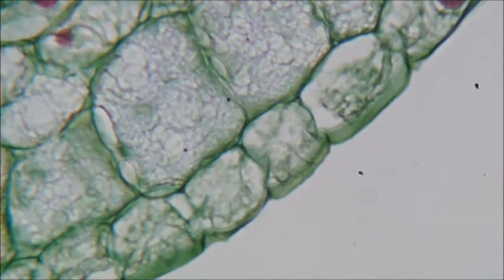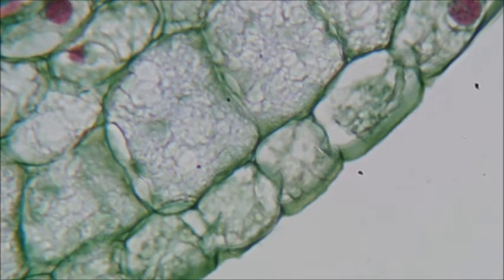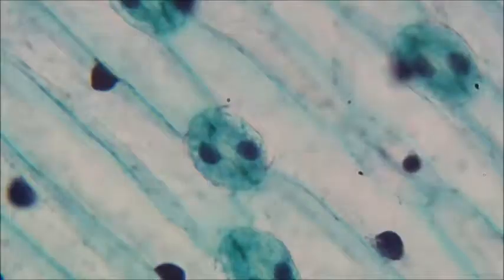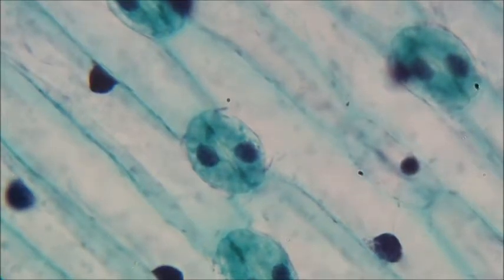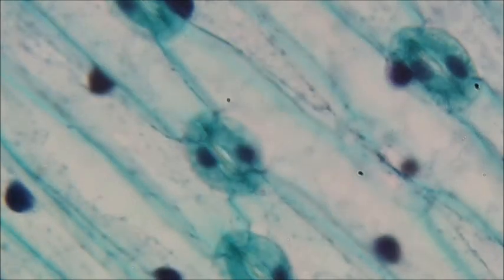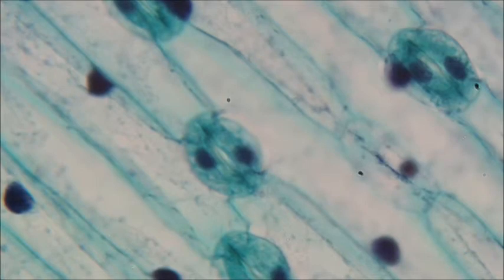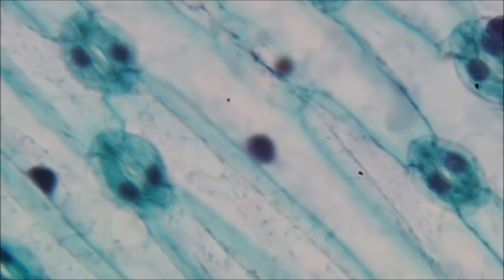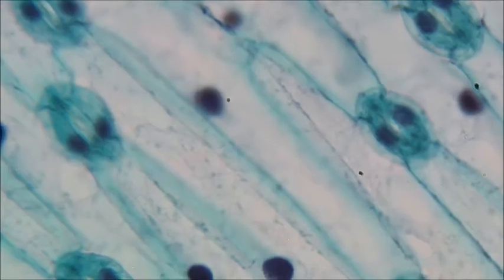It's kind of difficult to make out other organelles though, but I'll show you another plant cell and we might be able to make out some organelles. Okay, now we are looking at a leaf epidermis. So this is the outside of a leaf. You can see these cells are quite long and skinny, but all very neatly packed together. See that? It's one hugely long cell, and then you've got these little round cells in between.